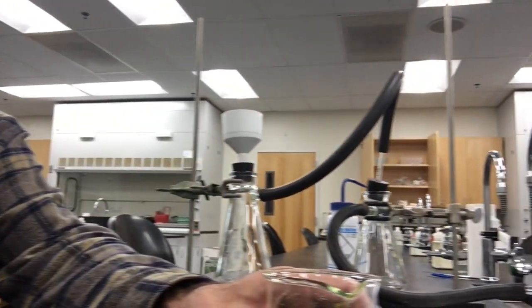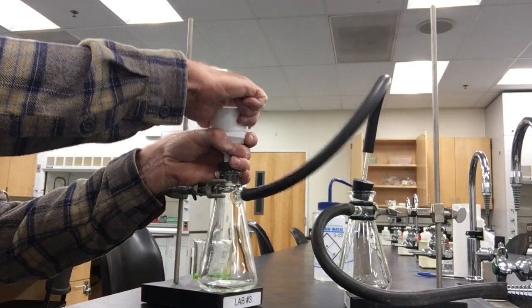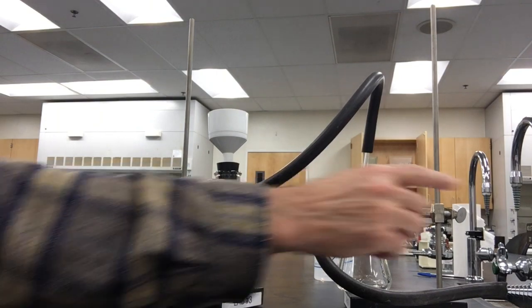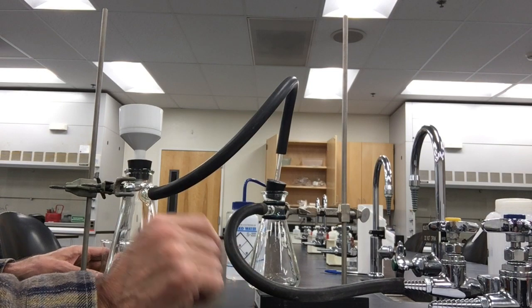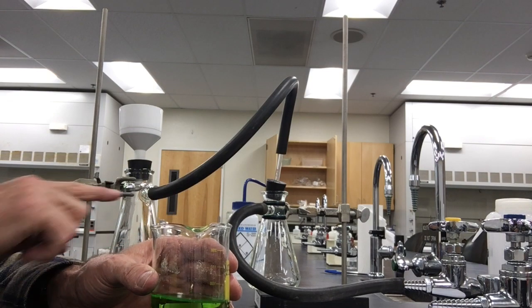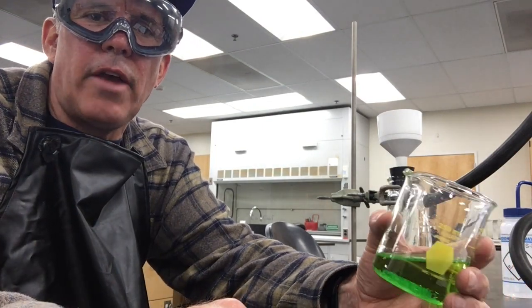What I have set up is a filtration apparatus. We're going to use suction. I'm going to put in the funnel, dump the crystals, and put in some filter paper first. Then I'm going to turn on the vacuum. But if any of the supernatant gets sucked through the hose, I don't want it going into our vacuum system, which is very expensive and is downstairs.